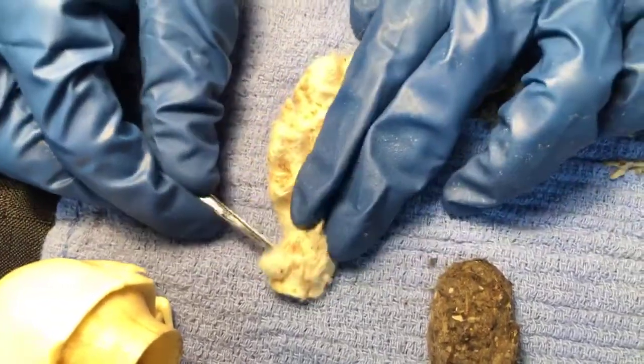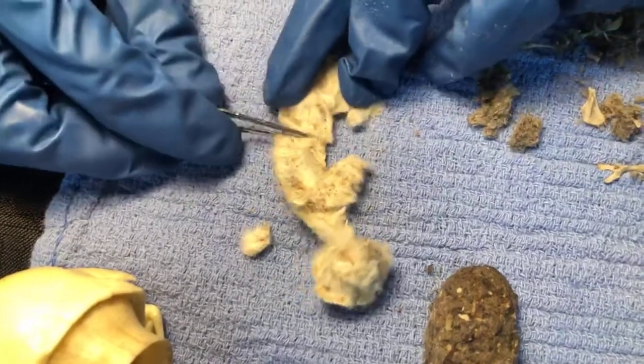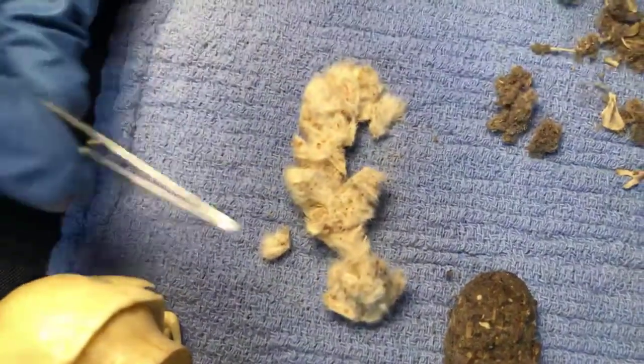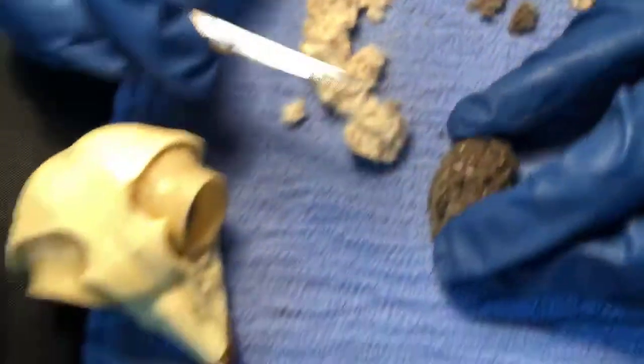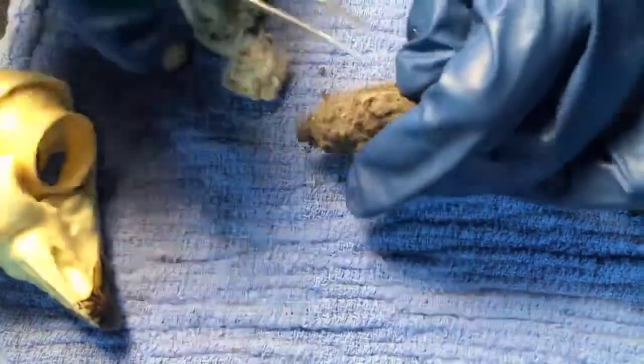Oh, that's so interesting. I just assumed that it's because hawks tear their prey up. No, it's the different acidity of their stomach acids. So that's just a big thing of fluff. Yeah, just a big thing of fur. We can see what we got in this one. And that was from Grace the Red Tail? Grace the Red Tail. This is probably about 2 or 3 for her.